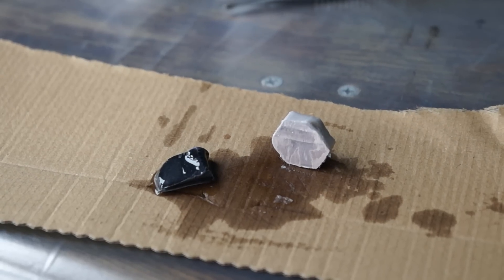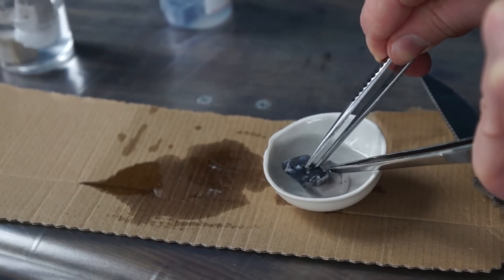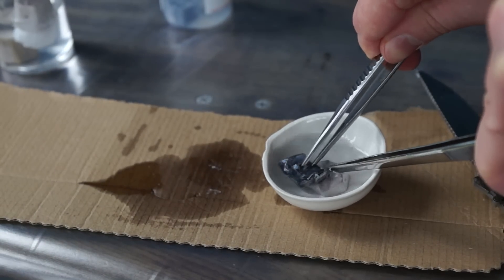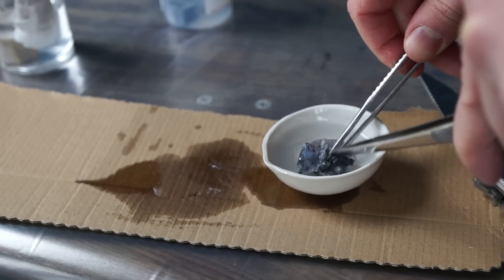For this I took a piece of sodium and potassium and began to rub them against each other within the evaporating dish. To prevent the alloy from oxidation by being exposed to air, I've decided to conduct the melting of sodium and potassium under a layer of kerosene.